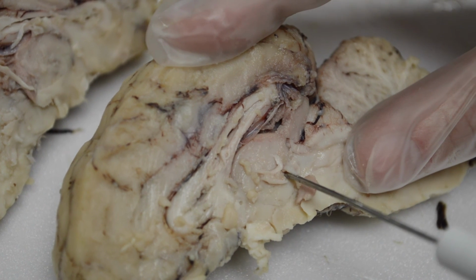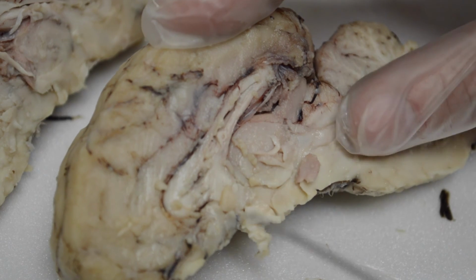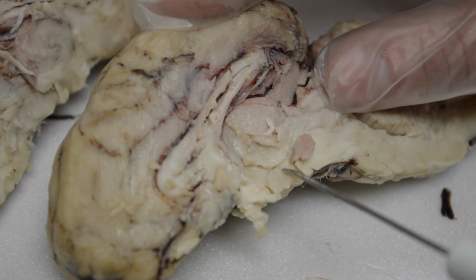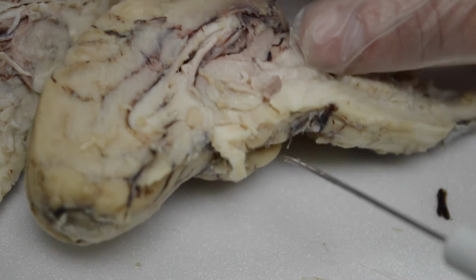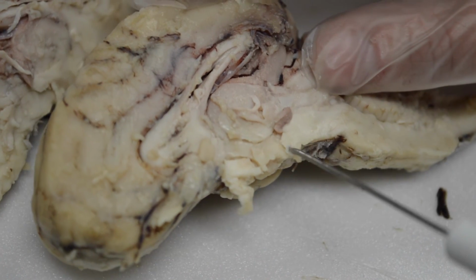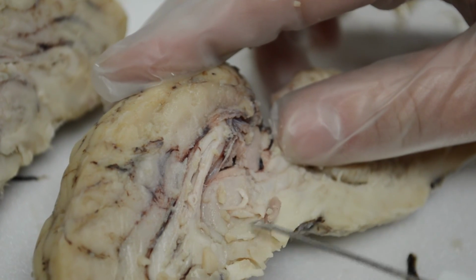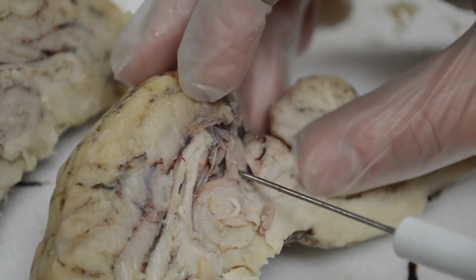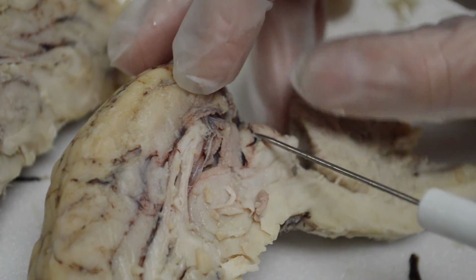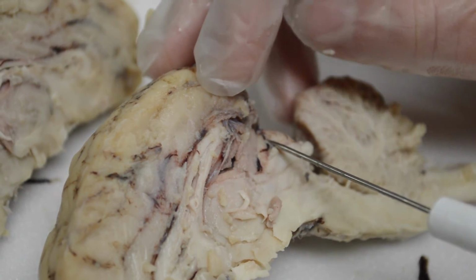That's the thalamus. This rounded structure, see the circle? That's the thalamus. Below the thalamus would be the hypothalamus here, and then the pituitary infundibulum, which we only have that little piece of, but the infundibulum would hang, and then the pituitary would be down here. So on top of the thalamus is the epithalamus that we peeked at from behind. This is the superior colliculi, the top of the corpora quadrigemina.